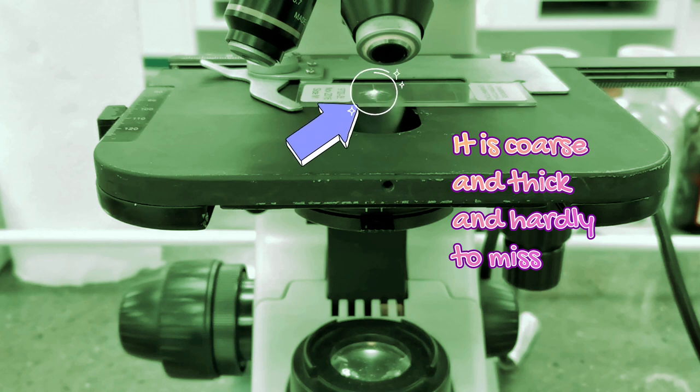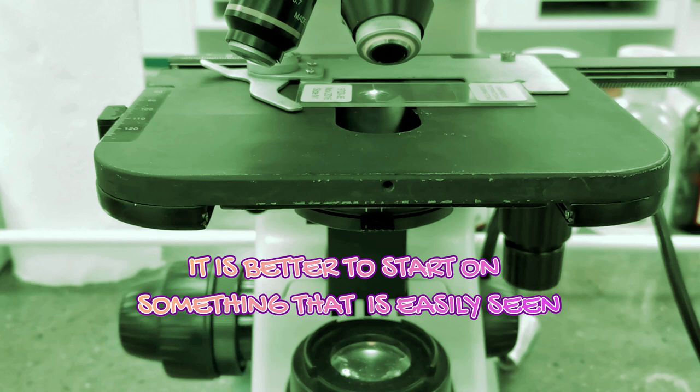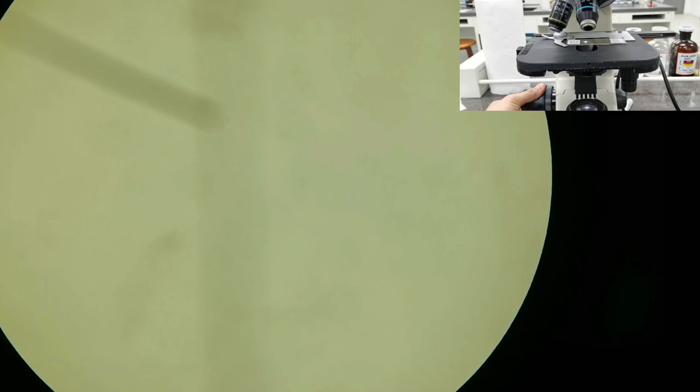The idea here is to look for something that is hard to miss. I will not start by looking at the specimen itself, because a plant stem or plant root is usually much smaller and thinner compared to the edge of the cover slip. So I will look for the edge of the cover slip instead. Looking into the ocular lens, I will use the coarse adjustment knob to lower the stage until I can focus on the edge of the cover slip.